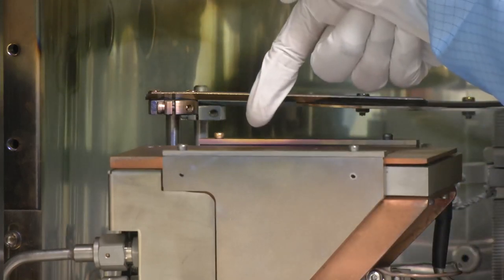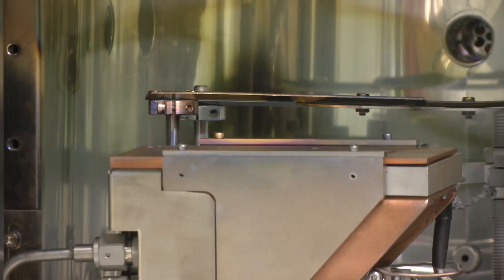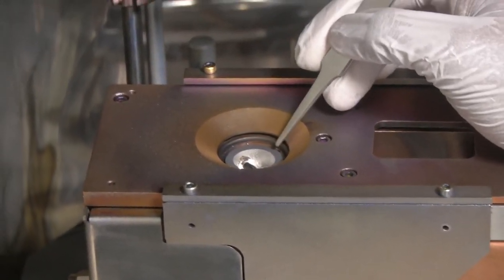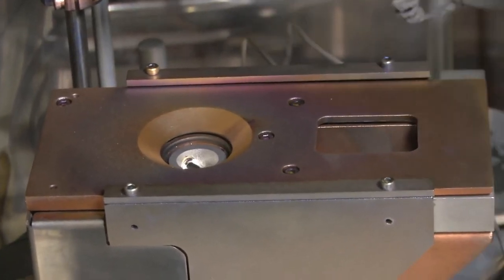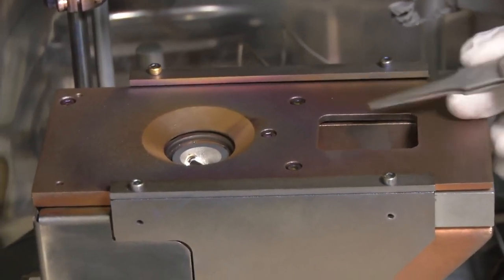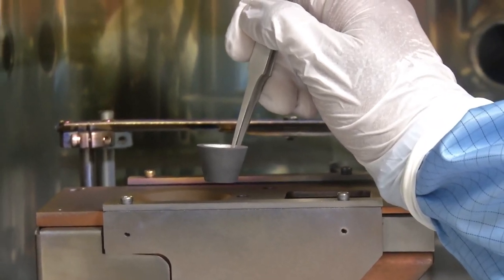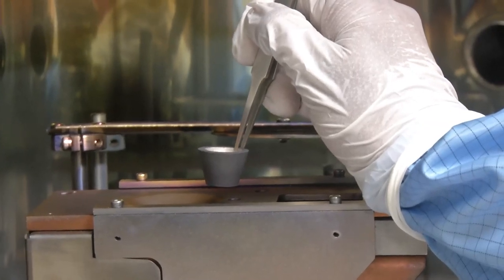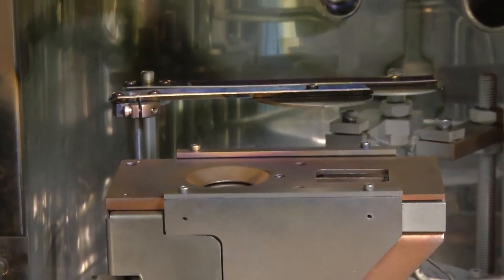The most important part of any electron beam evaporation system is the crucible. This is a target crucible, which means the target material is loaded onto it. The electron beam is generated to the right of the crucible, and by applying a magnetic field located on the sideways of the filament, we can direct and focus the electron beam onto the crucible. Materials used for crucibles are generally graphite, tungsten, or molybdenum, due to their very high melting points.